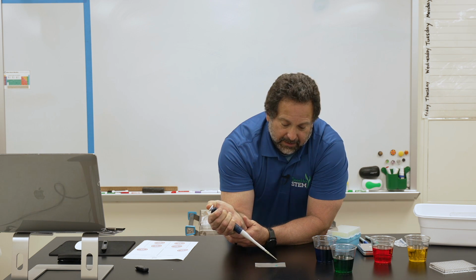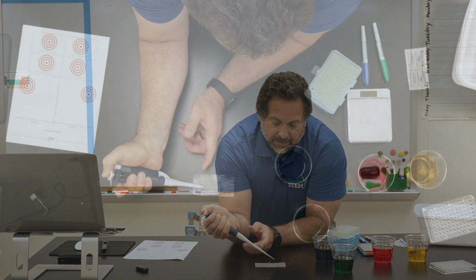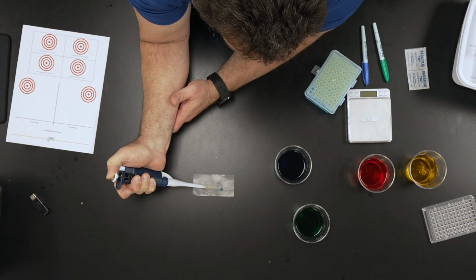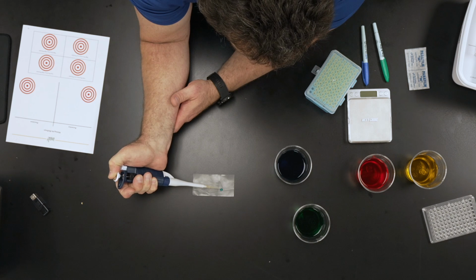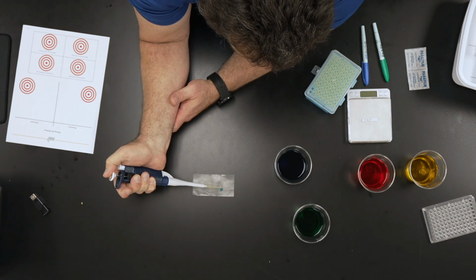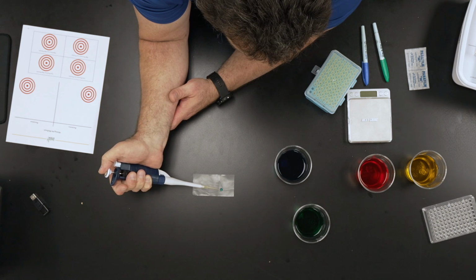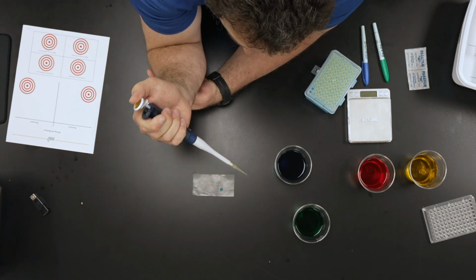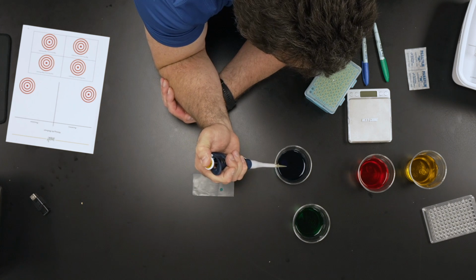Now see if there's a little, I don't know if you could tell, there's a little tiny amount of liquid left in there, okay? So that's where I go to the hard stop now. I've got that there, I'm going to push to the hard stop, and it pushes the rest of that out. Now I've got nothing in that pipette tip, okay? And that's actually how I could put some drops on there. So let's take a look, and I'll try this again.